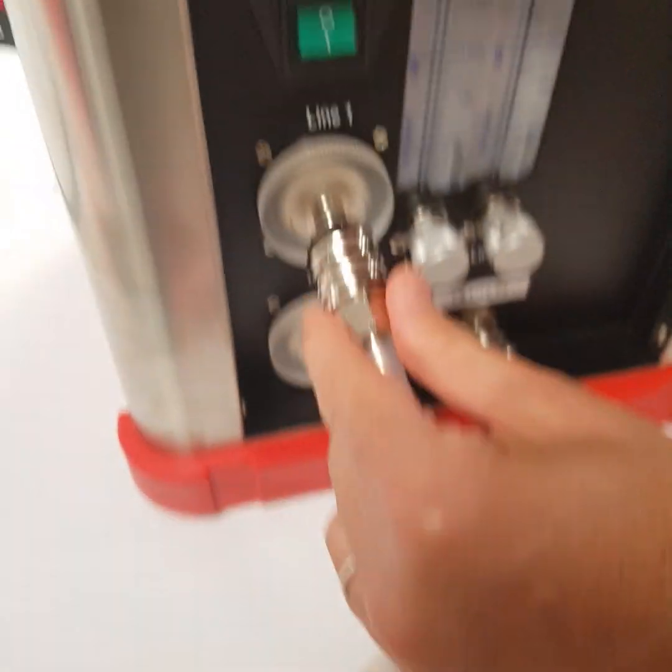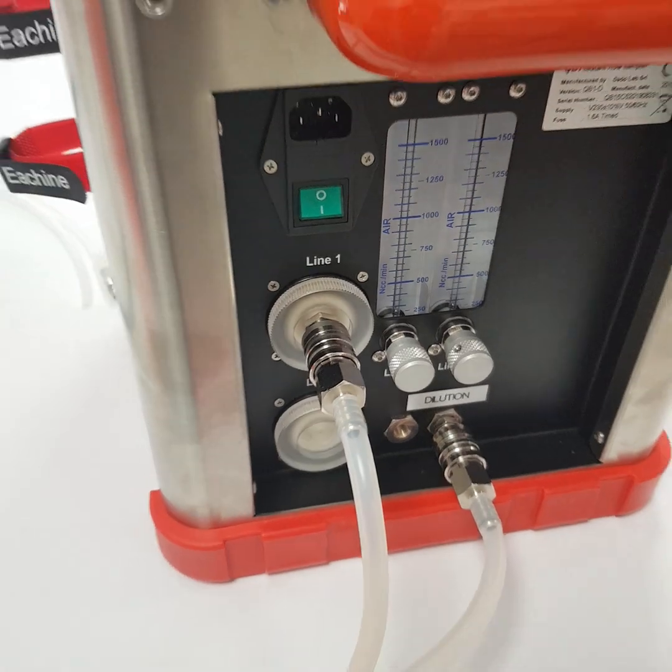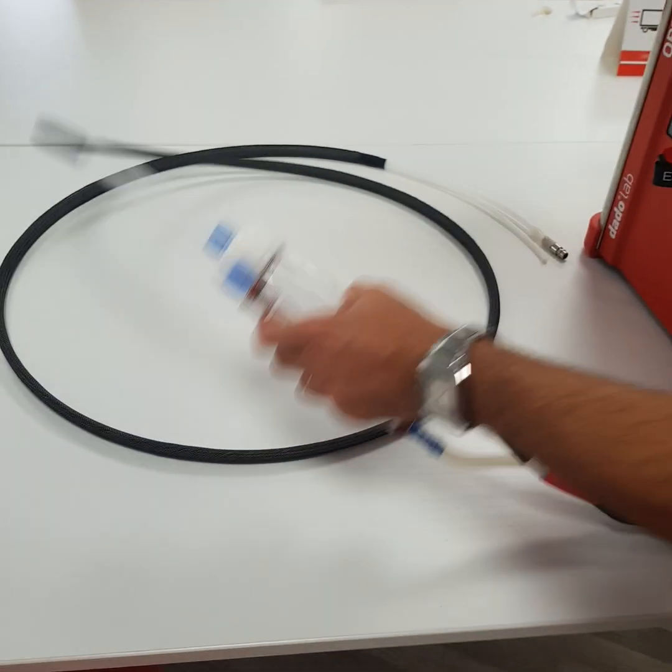The other one has to go to line one. We can fix it here.